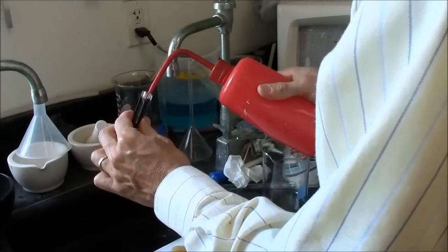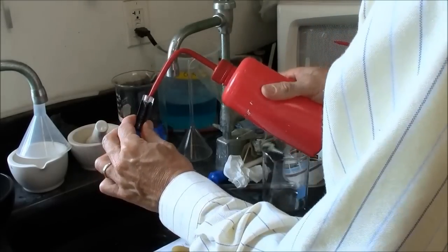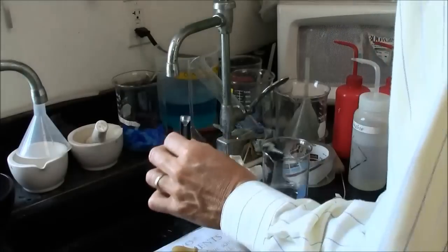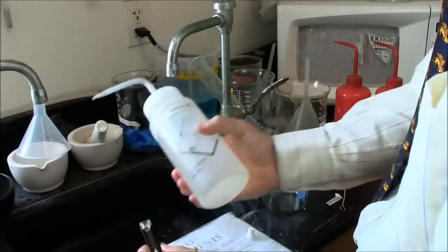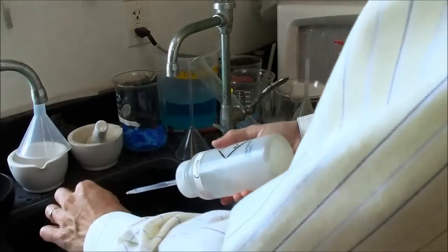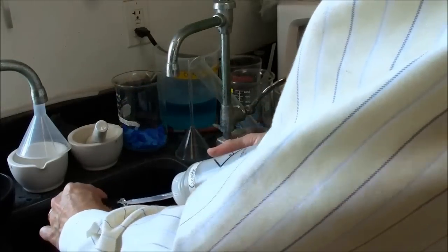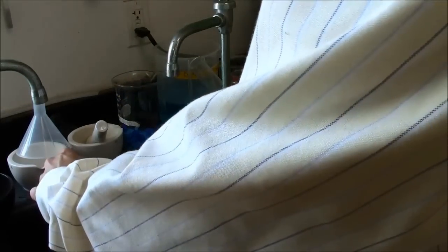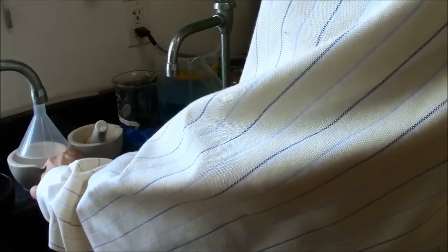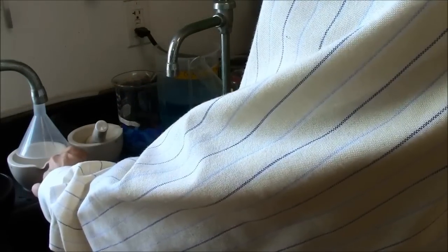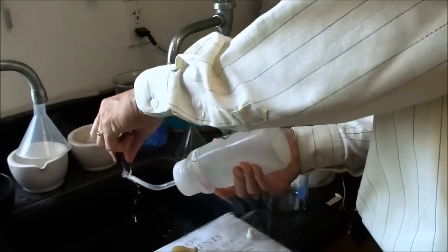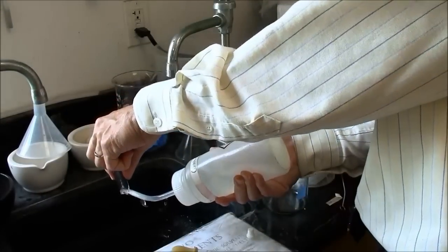Wash it at least twice, maybe three times. This is a cuvette washer that works in the inverted orientation. It's just got water in it. But that's how that works.